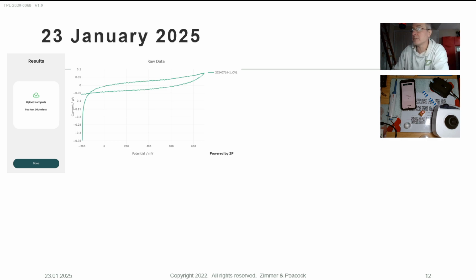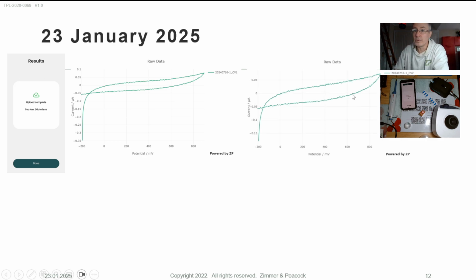There you can see no capsaicin, but we at ZP can drill through their data. The powerful thing is we can see their data, so it's important to see that if you're using the FoodSense Generation 4 and you get an error message, so it says here upload complete, too low, dilute less. So I've got that error message here, or if you can call it an error, information is a better term. It's actually informing you what to do. But don't just go on to test. Go up to Djuli and look, and ask yourself, where is my peak 1, my peak 2, and my peak 3?